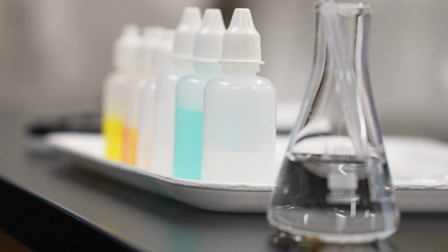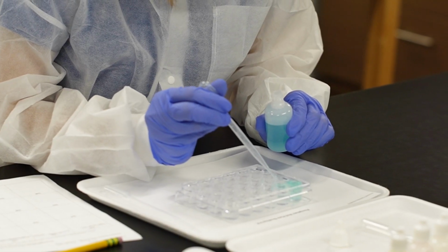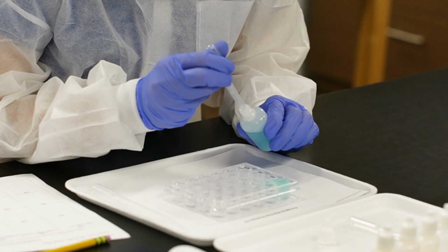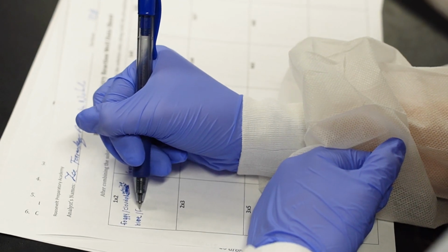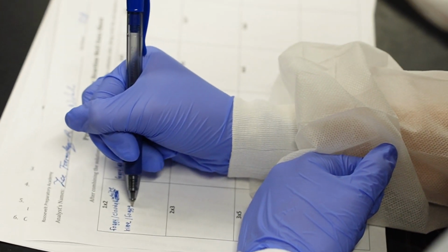Now, this is kind of like one of those magic mystery square type things where they have 7 unknown solutions, and through a series of cross-matching and mixing these together, sometimes they will have something that's called a precipitate that forms, meaning that a new insoluble product comes out of the reaction and falls out of solution. Other times they'll see color changes. Sometimes they might have a double precipitation. Sometimes they might have no reaction whatsoever.